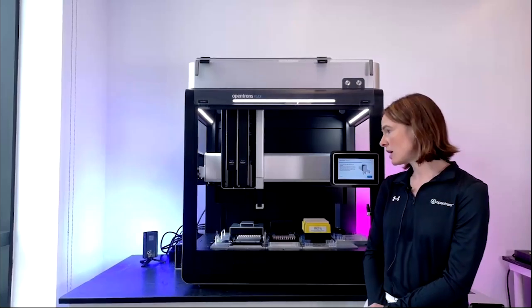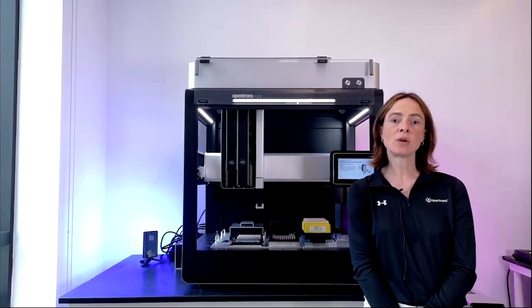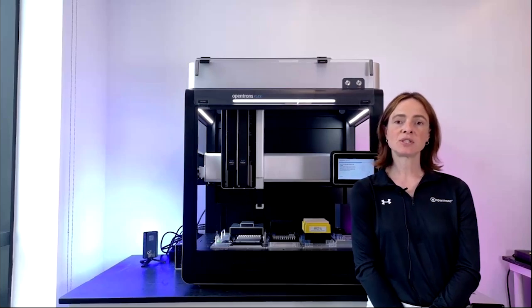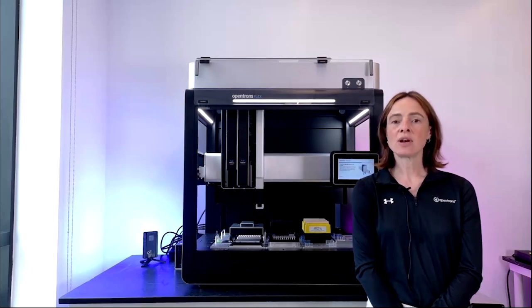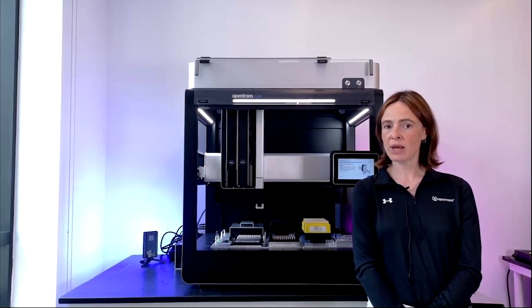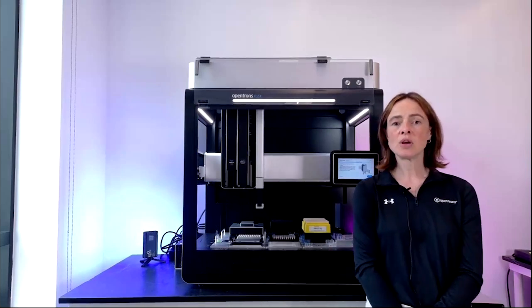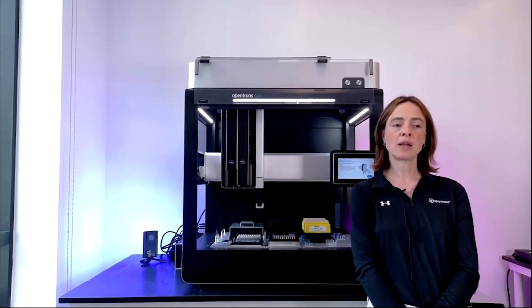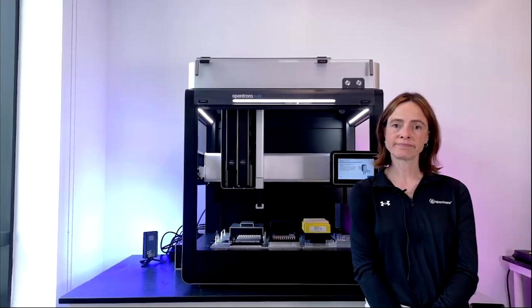Before we get started talking about the robot, I wanted to say a few things about Opentrons' ethos and why we exist. It's our mission to support scientists doing groundbreaking, valuable research with powerful, accessible lab automation. Our aim is to really free you to do more than pipette and be able to focus on science. We've helped thousands of labs across the world automate their workflows. And with the Opentrons Flex, which is our newest generation robot, we're excited to show you how it can help you and your lab increase your throughput and automate your workflows.